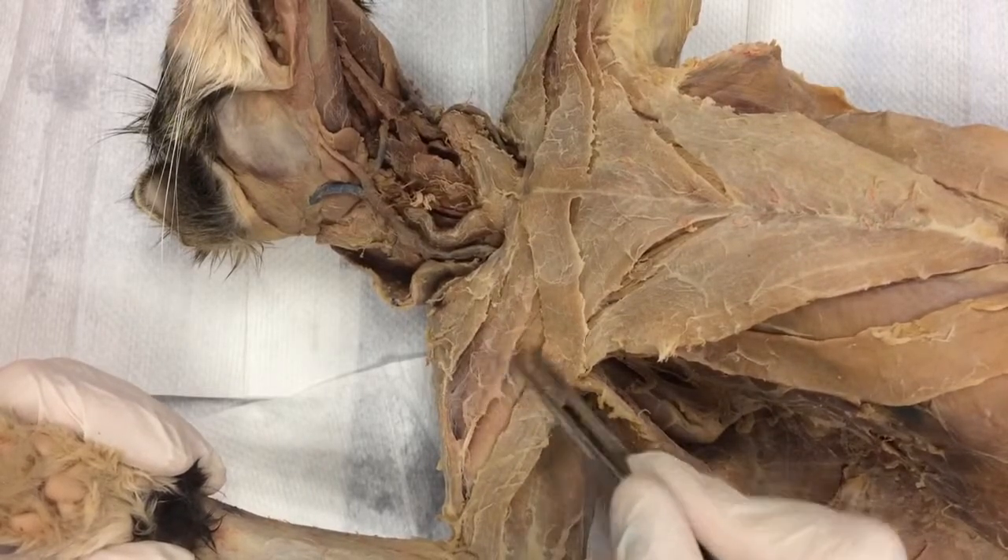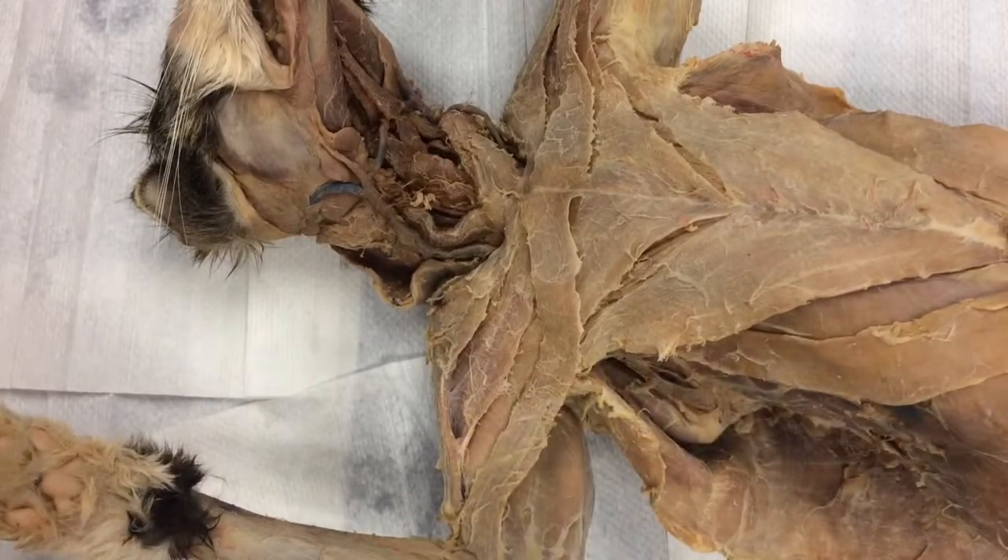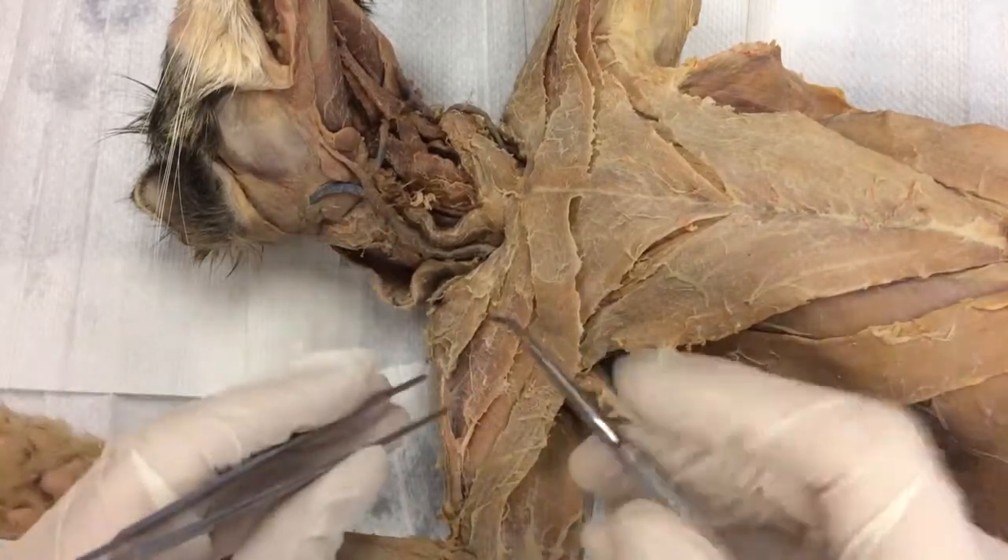Not this one — that's the upper fibers of major, I'm going to leave that down. It's this one. Watch how easy this is, and I'm going to have to flip this cat a little bit.